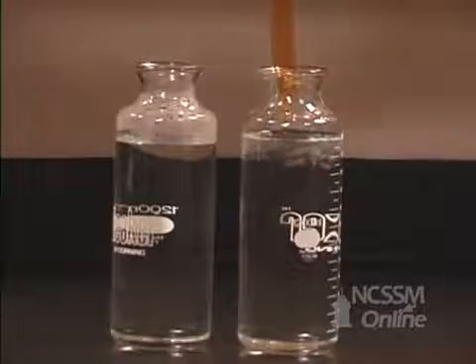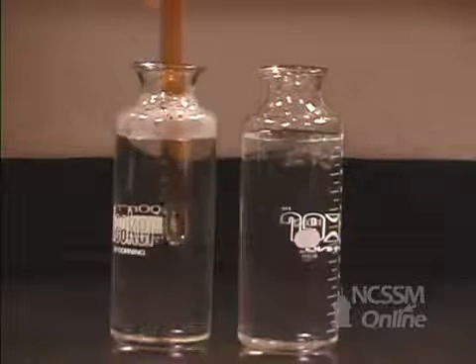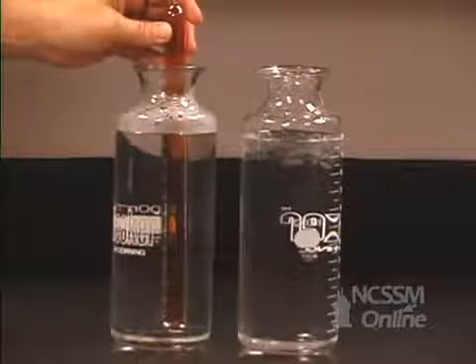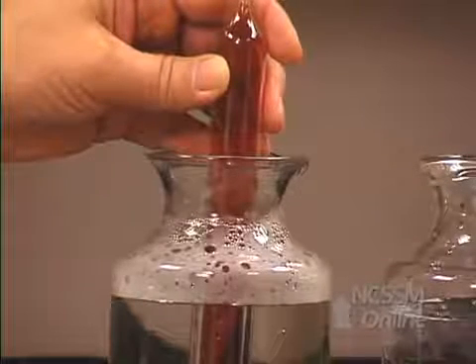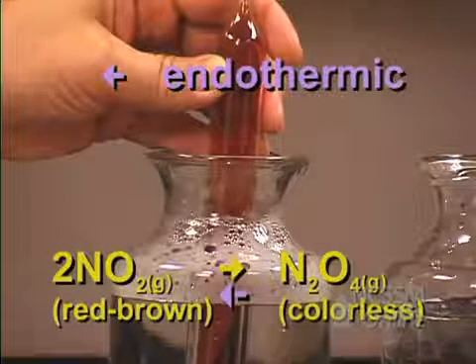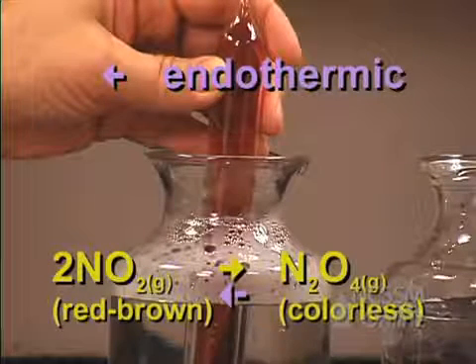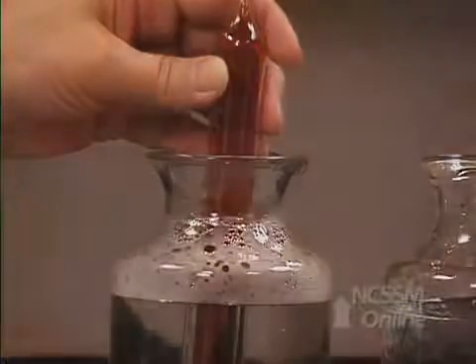We'll place the tube in a warm water bath. We notice that the color in the tube gets darker, indicating an increase in the concentration of NO2. As we warm a mixture, it shifts in the endothermic direction. The tube became darker, which indicates that the equilibrium has shifted in the reverse direction.